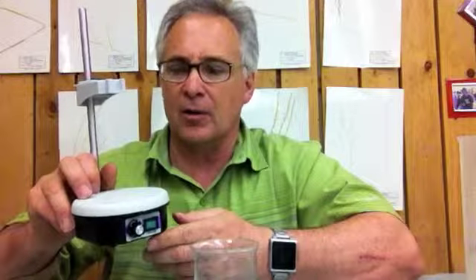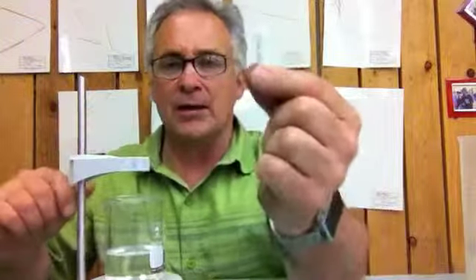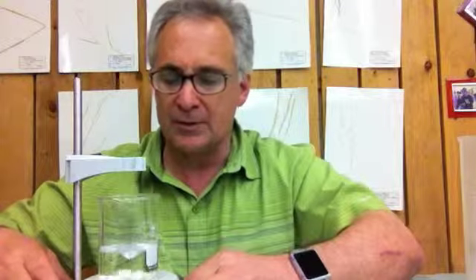We're also going to use this stir plate. We have a variety of different kinds, but this is our newer variety. Obviously, make sure it's plugged in, and then you have the ring stand built into it. So you're going to put this right on the stir plate, and then make sure you get a magnet, because a magnet is going to spin on the inside of the beaker. Let me see if I can get it to move. I don't know if you can see that, but that's going to spin just like that inside our beaker and basically mix the solutions as we put them in. So I'm going to put that right in the center, and I'm just going to turn it on.